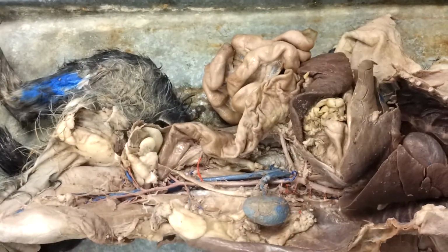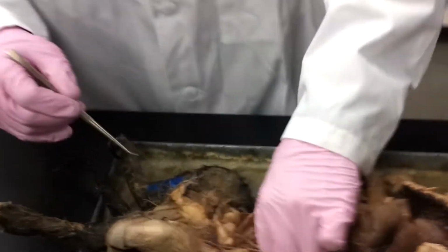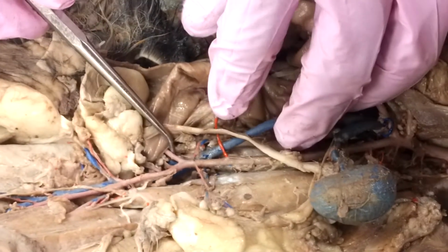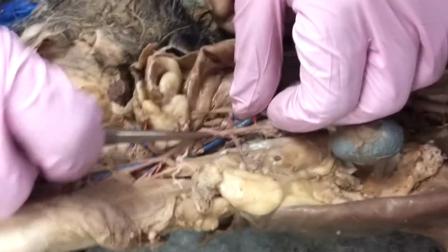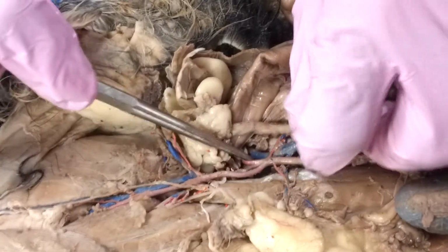Now, one of the differences between the arteries and veins is that the inferior vena cava is going to branch down, and now we are going to have a common iliac vein, and we are going to have an external iliac vein. So that's one of the differences. Again, remember, we don't have the common iliac artery. So let's see if we can find it. Inferior vena cava. Here are those beautiful external iliac arteries, and we'll see if we can move them to the side a little bit. And where that bifurcation is, there it is.